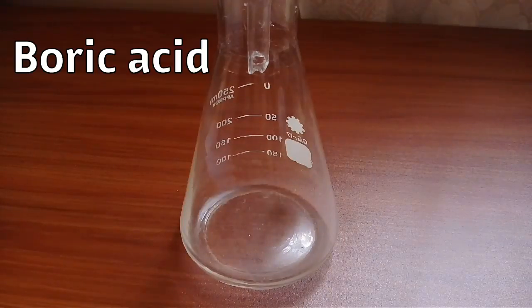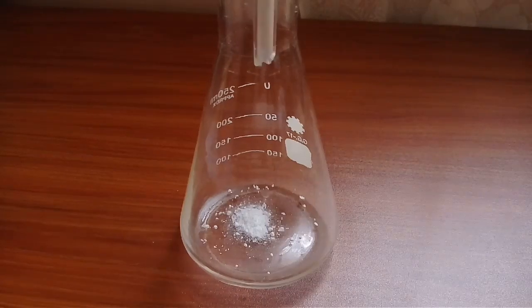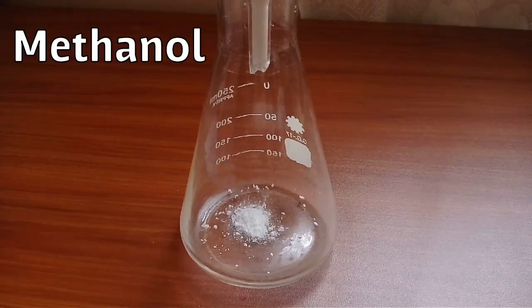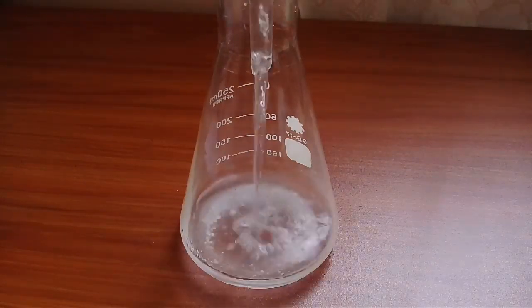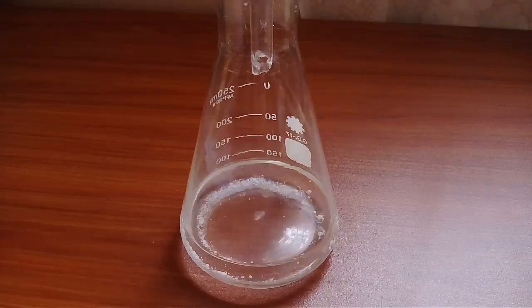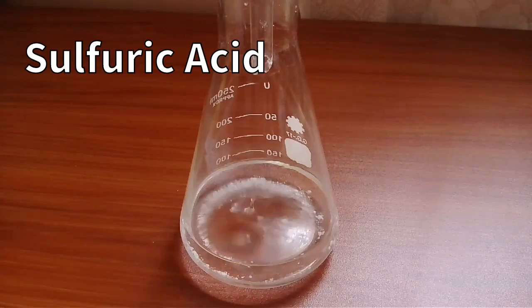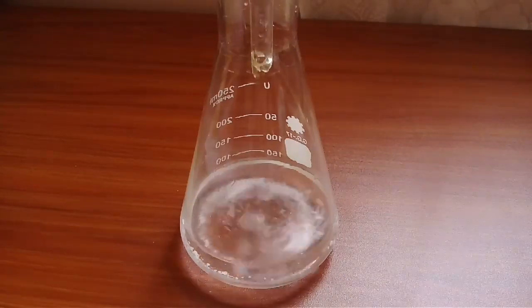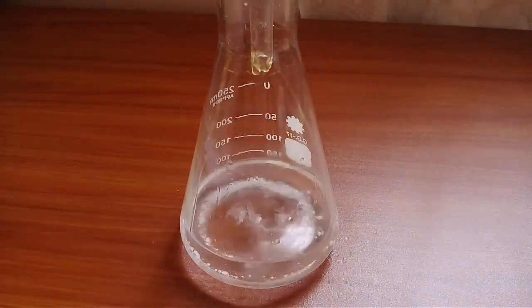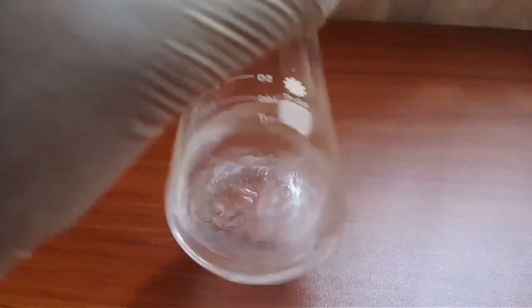Now I add some boric acid crystals here, and then some methanol. After that, very few drops — milliliters — of sulfuric acid. Now we need to dissolve all the boric acid crystals in this solution. When all the crystals dissolve in the mixture, we are done.